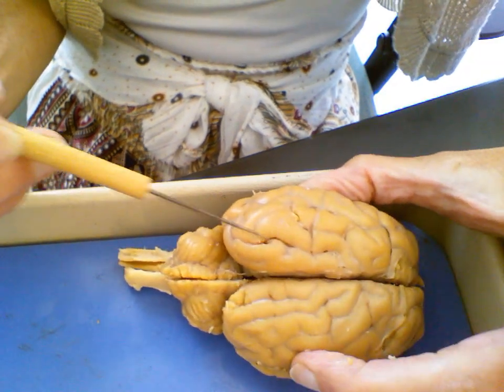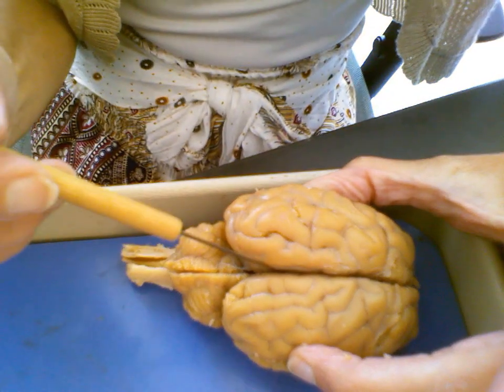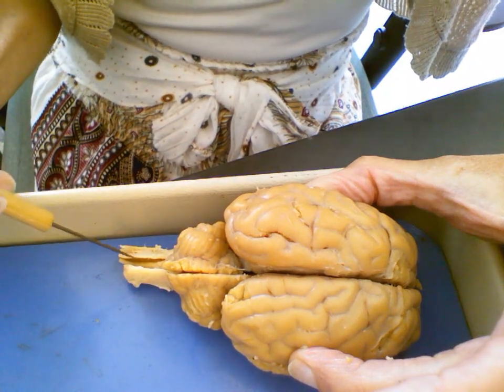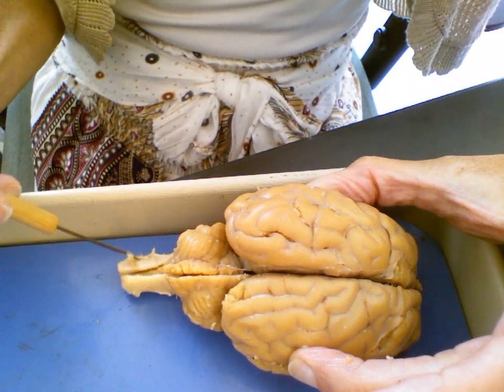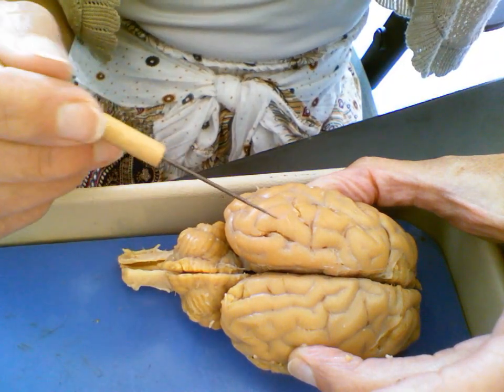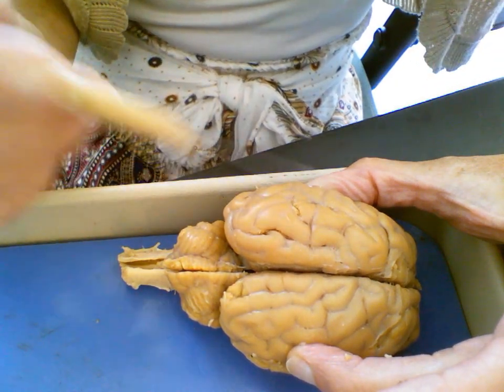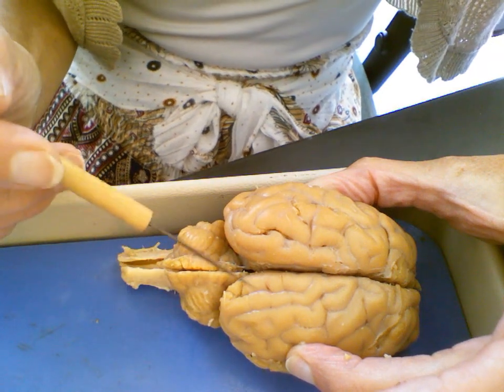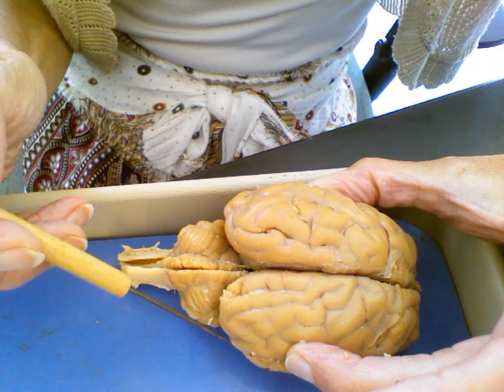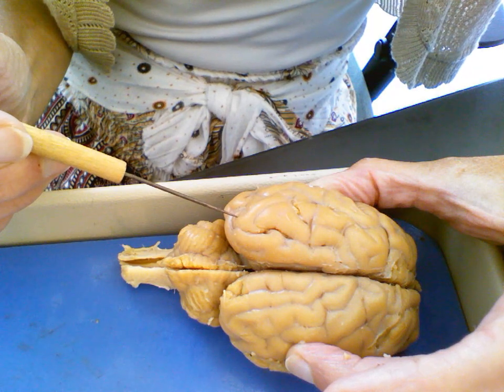We have the cerebral cortex, divided into two hemispheres by the medial longitudinal fissure. We have a spinal cord down here, which is just at the tail, at the caudal end of this specimen. We have gyri, we have sulci, and we are going to take it from there. So back here in the backside, we're looking at this area right back here as a lobe, and it has a functional relevance. So this part right back here is called the occipital lobe.